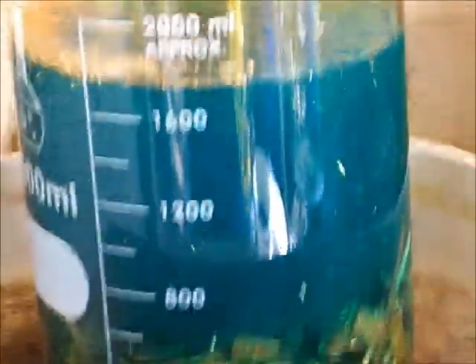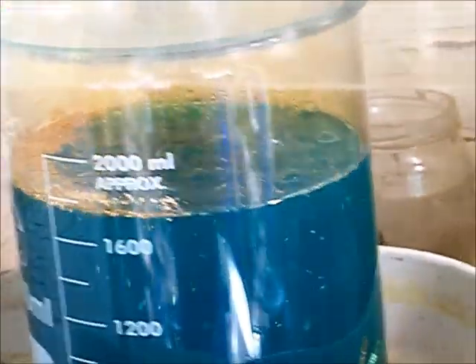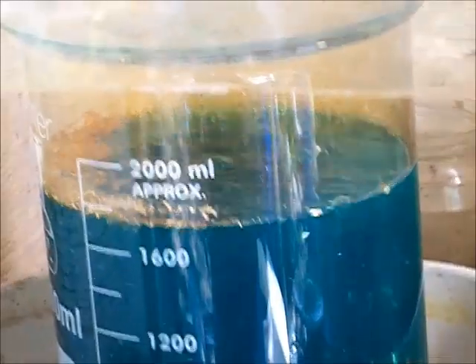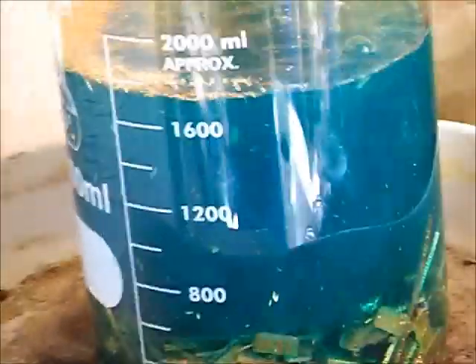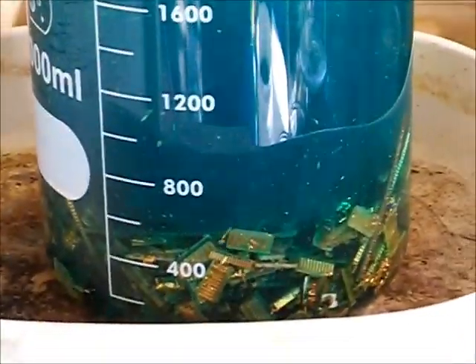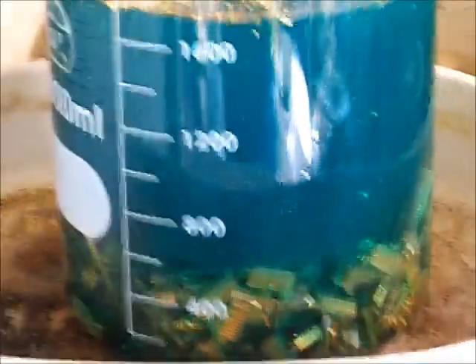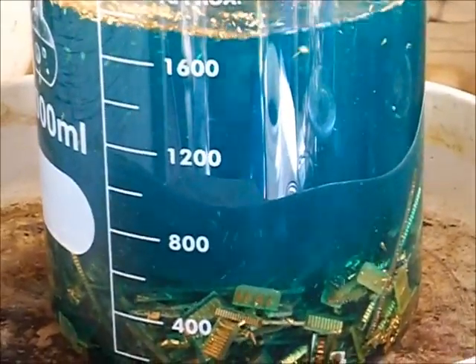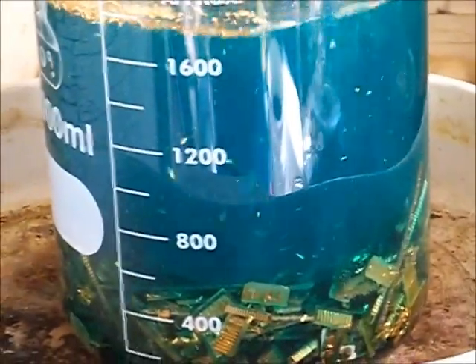This will proceed and one of two things will happen: either the base metal dissolves and the reaction stops, or the solution gets saturated and the reaction stops. You really have to have some kind of bad mishap for this to go wrong. Whereas AP will take you weeks, you can get this same amount done in hours.